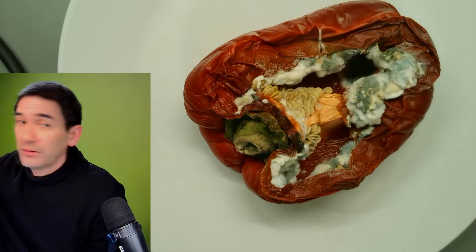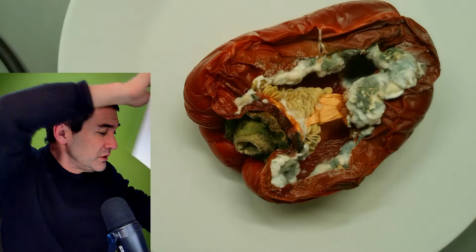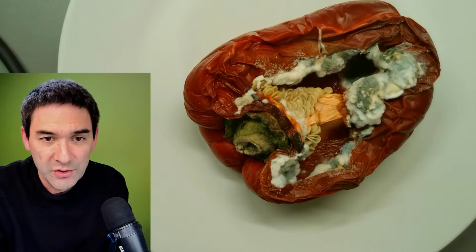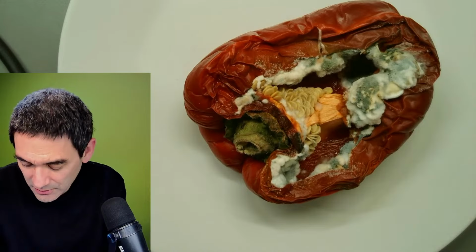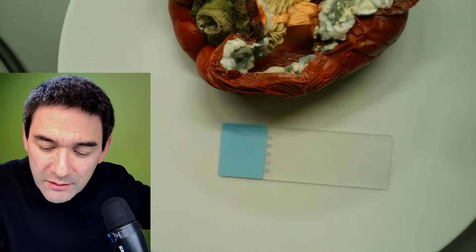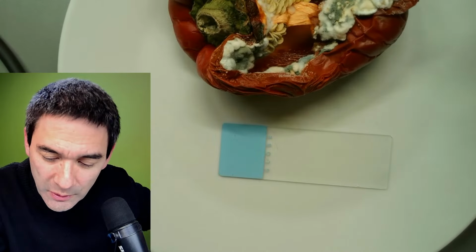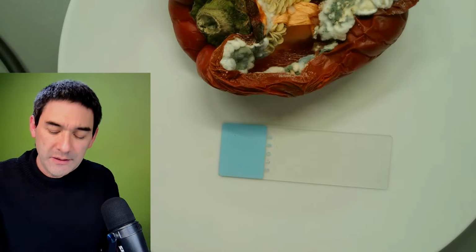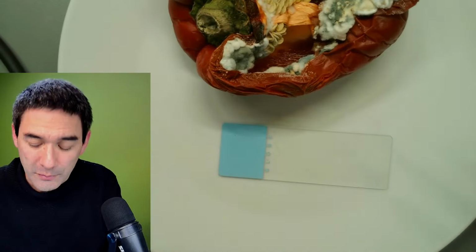Oh, okay, thank you. The questions again, but you know what? Because I have not done this, I want to put this also under the microscope. Okay, so that we do a little bit of, how do you call this, compound microscopy as well. Just another thing I want to show you where you've got to be a little bit careful, and I'm talking also from my own experience.